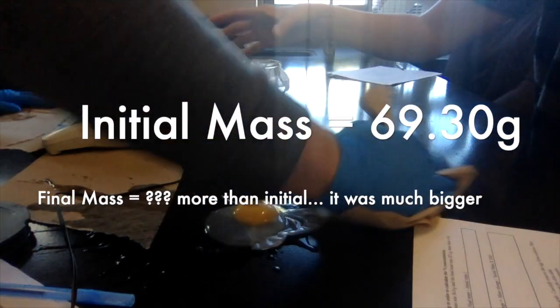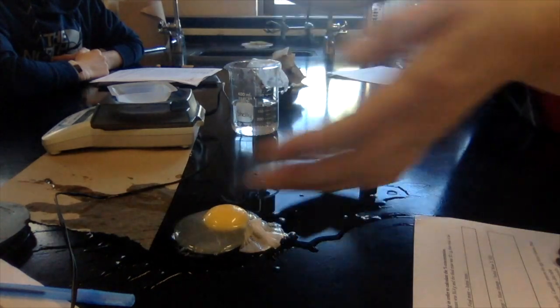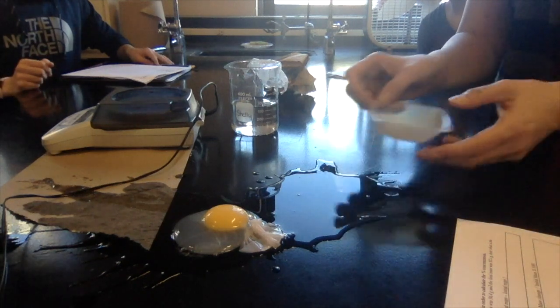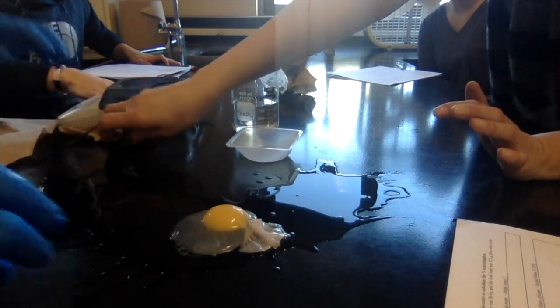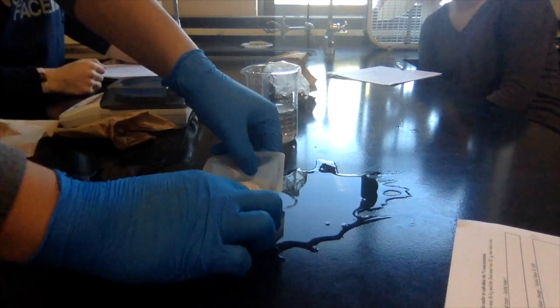So we have no, because that's mass. All that water is the mass of the egg. Oh, okay. So I'm going to come back, and you're going to try and scoop up as much of that as you can into there. Okay. I'll come back. That's fine. Is there any fructose in the water? No. Okay, so no fructose in the water.